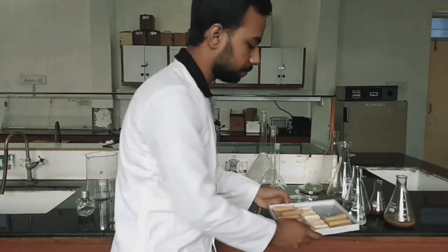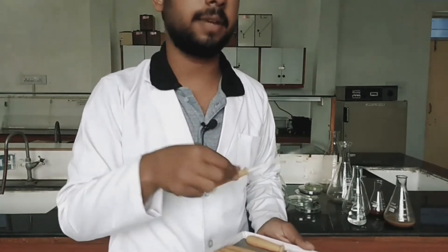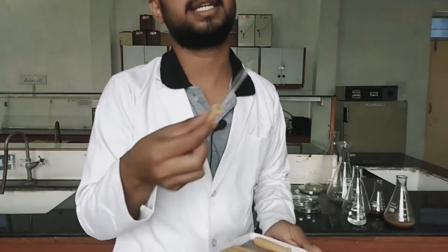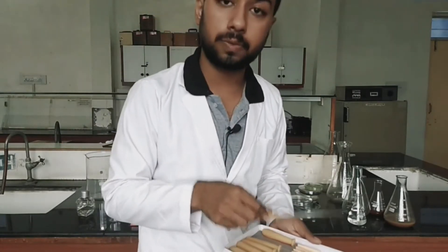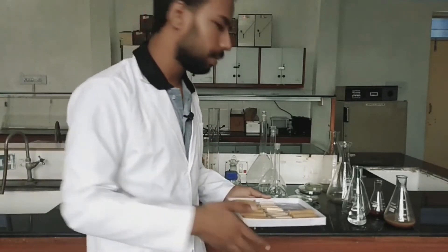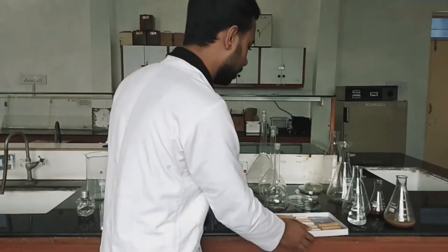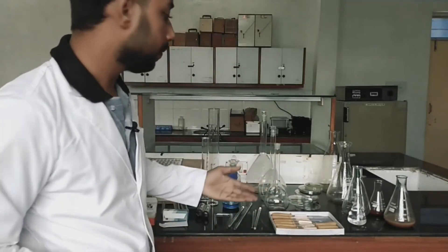Next one is the dropper. This is a glass dropper used for dropping different chemicals and solutions such as HCl, H2SO4, and different types of acids or bases. So this is also a glassware.